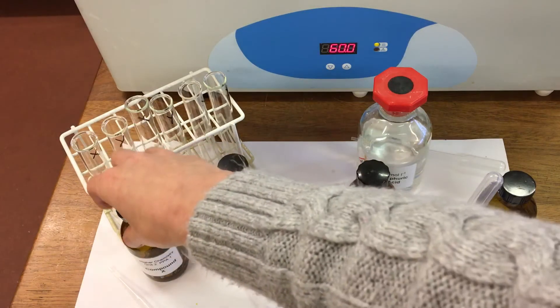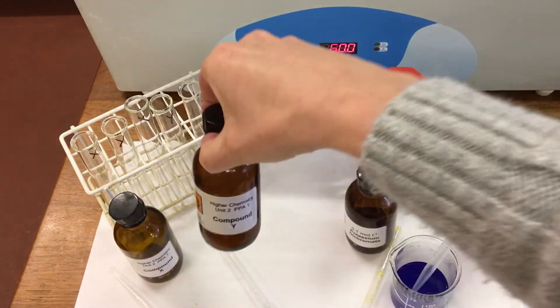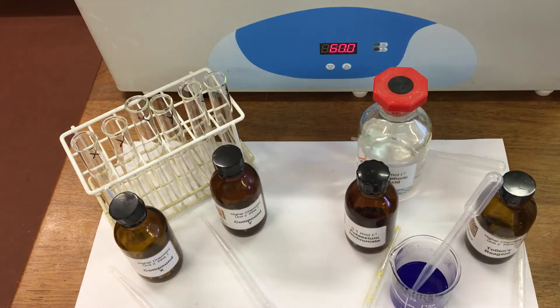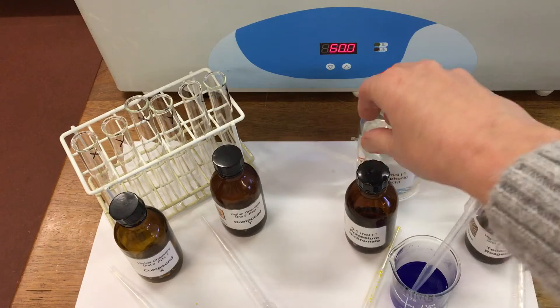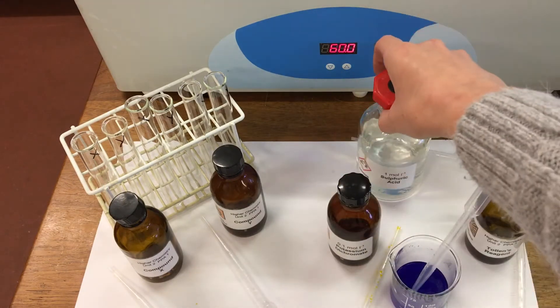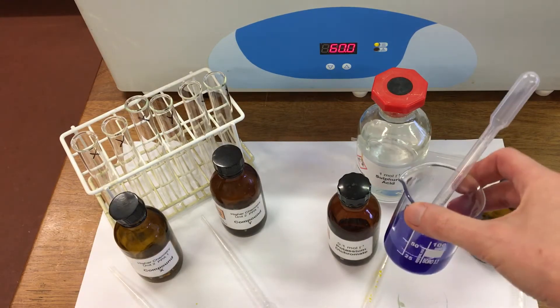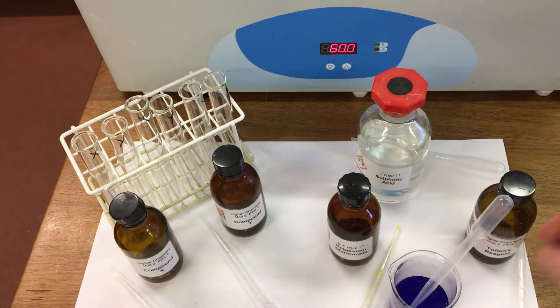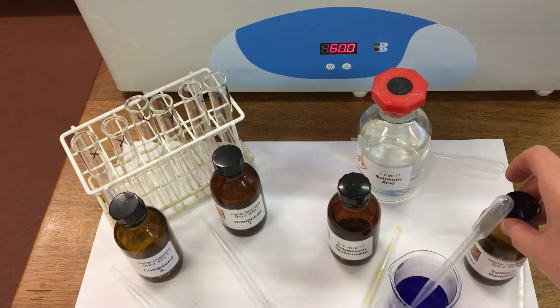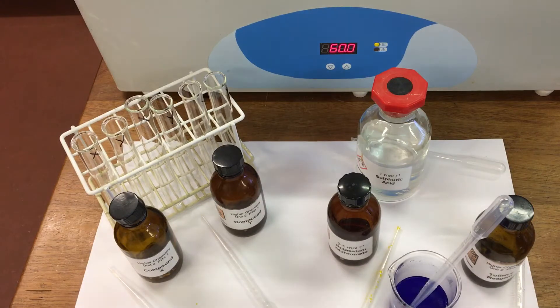We've got two different compounds, compound X and compound Y, and we're going to use three different oxidizing agents. The first one is potassium dichromate, acidified with sulfuric acid. Our second one is Fehling's solution, and the third one is Tollens' reagent. We're going to try each one in turn and see if compound X and compound Y oxidize.